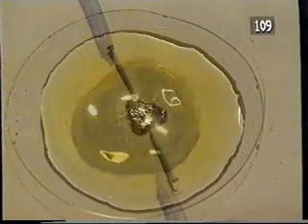What you are seeing here is a chemical reaction, a mixture of chemicals reacting together to give products. And as they do so, we observe an effect. In this case, movement of this drop of liquid metal, mercury.